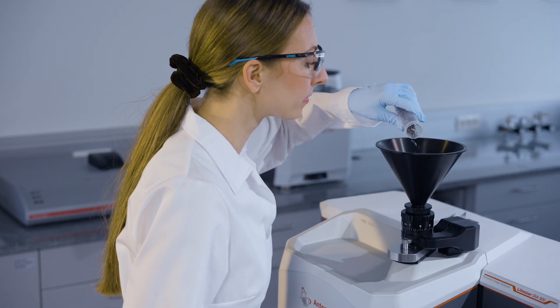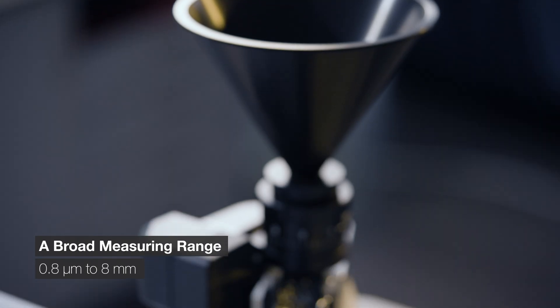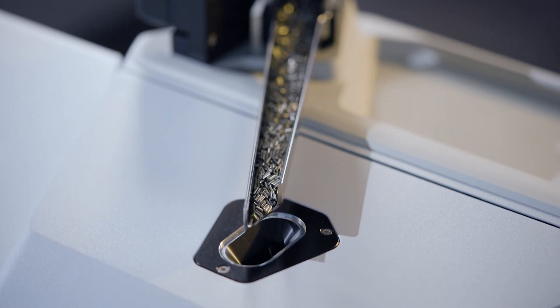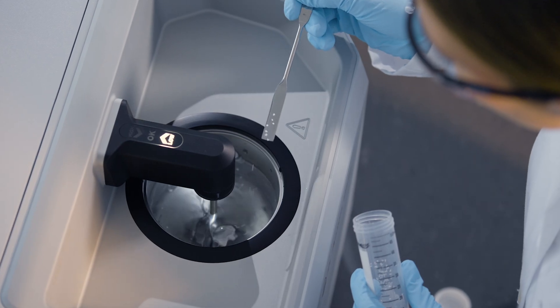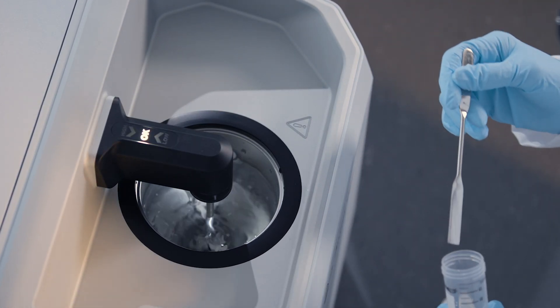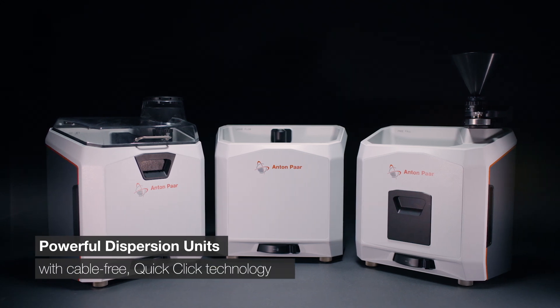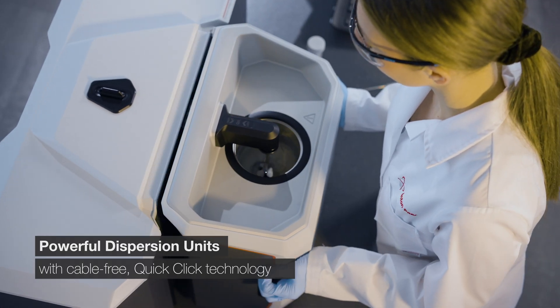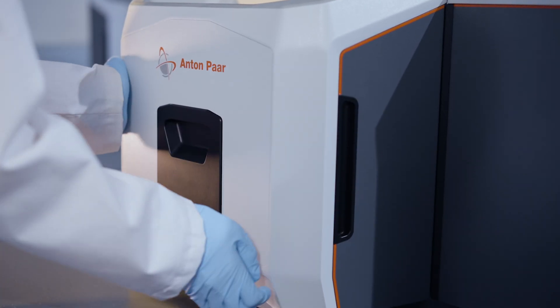Flexibility like never before. You can measure the size and shape of millions of singular particles in every measurement. Access excellent dispersion of nearly any sample with our powerful dispersion units, and you can switch between them in just one move.